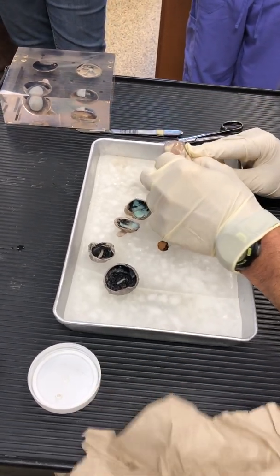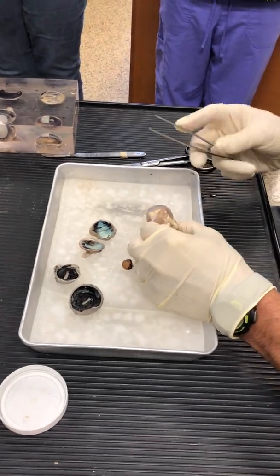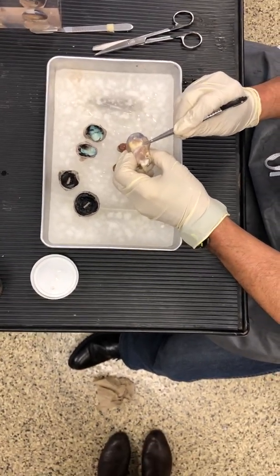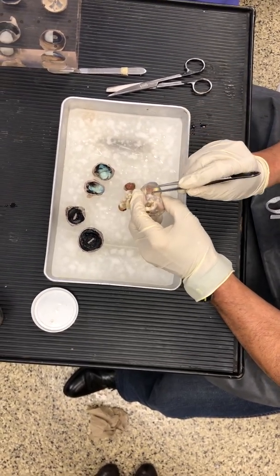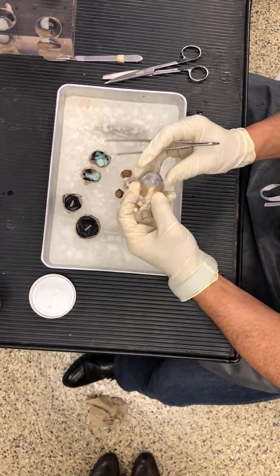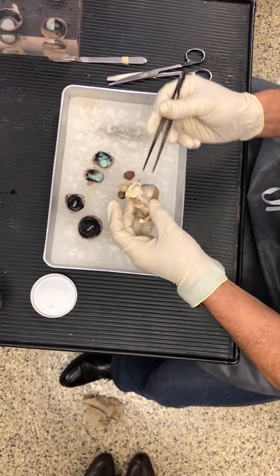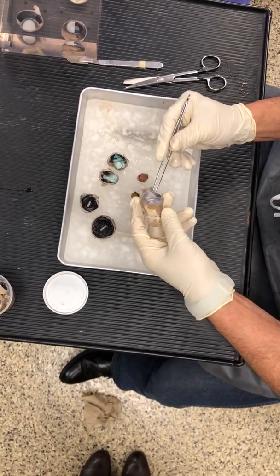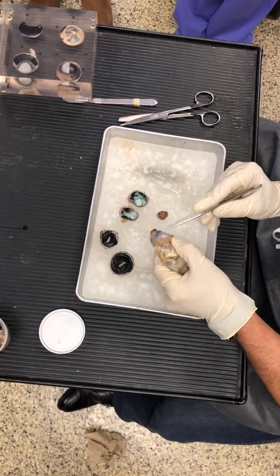There you can see all of the muscles around the eye. We didn't name the muscles here in lab. We're going to label and name all of the muscles when we get to the lecture. There are 6 eye muscles. We will learn them when we get to chapter 16. So you can see lots of fat, adipose, around the eyeball. And what is the function of adipose around the eyeball? Protection. Yeah, padding. Primary function is padding.